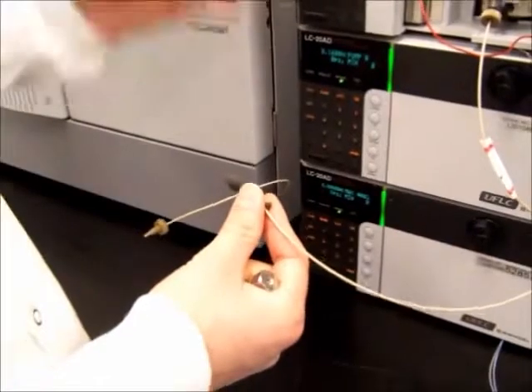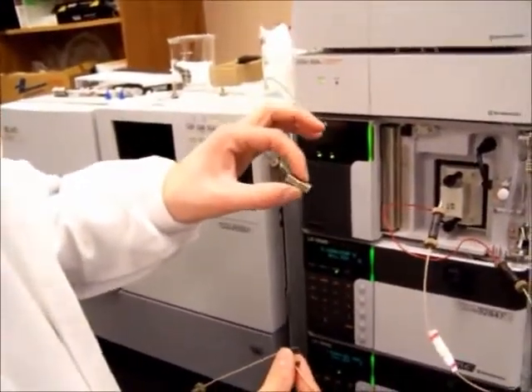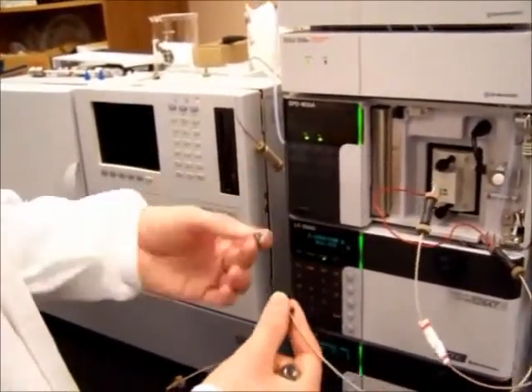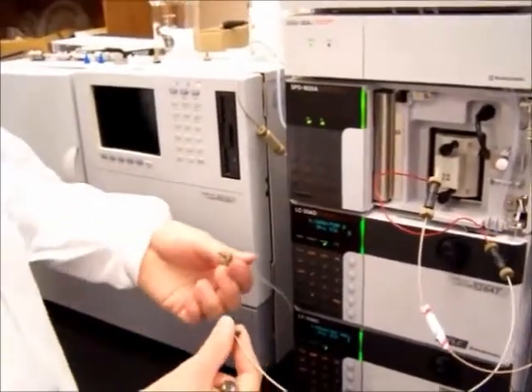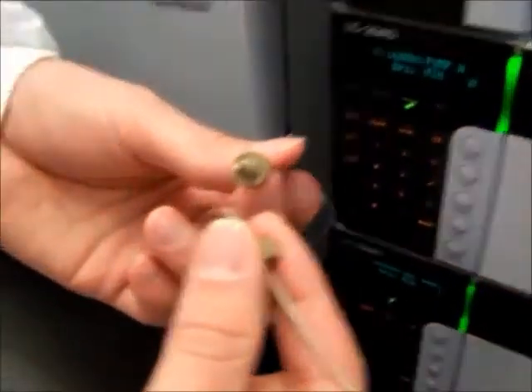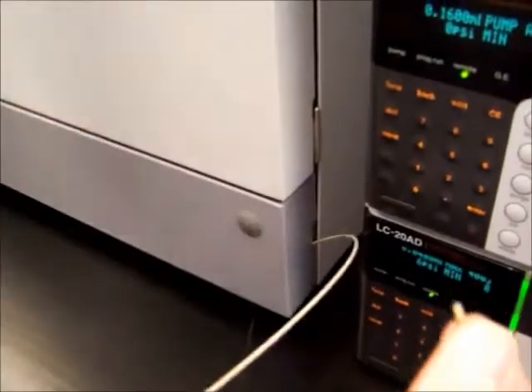This is a neat little connector here. This is used to just connect different bits of tubing together, but it's also used when the LCMS is not in use, just to keep these tubes clean. You can't see it, but the PEEK tubing itself is extremely fine, and there's a very, very small hole in the bottom.